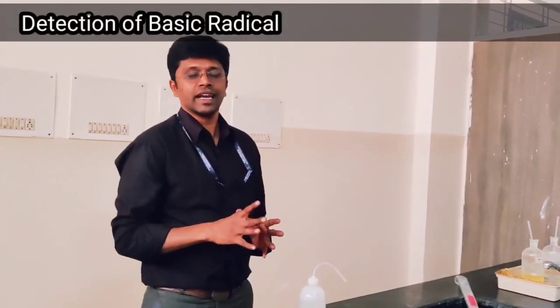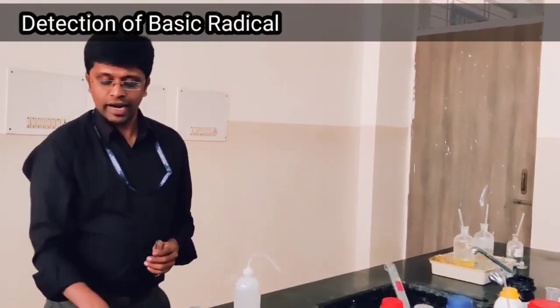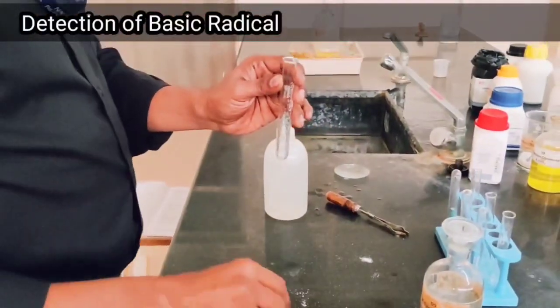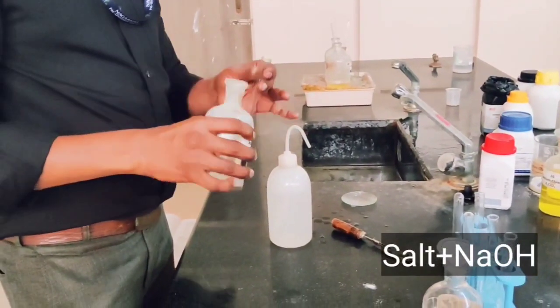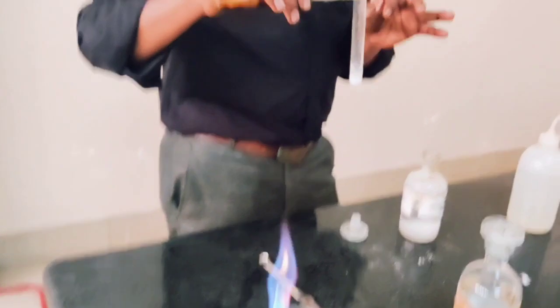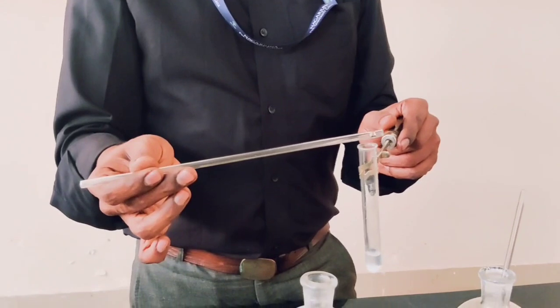We are going to analyze the basic radical starting from zero group. The zero group basic radical is ammonium. For that we take the salt and add sodium hydroxide solution. After heating, we are not getting any pungent smell, which shows that ammonium is absent in the given salt. The glass rod dipped in concentrated HCl is exposed to the mouth of the solution — no fumes appear, confirming ammonium is absent.